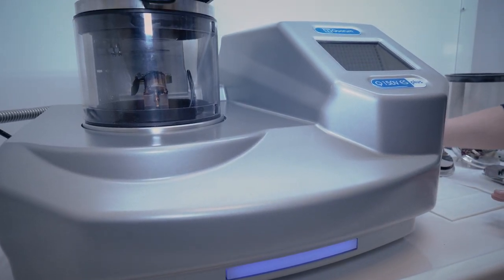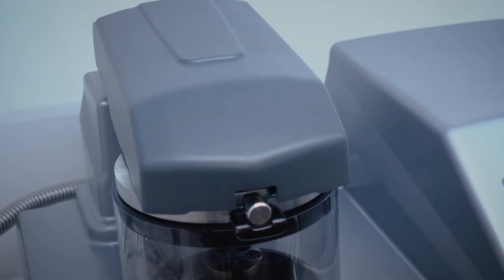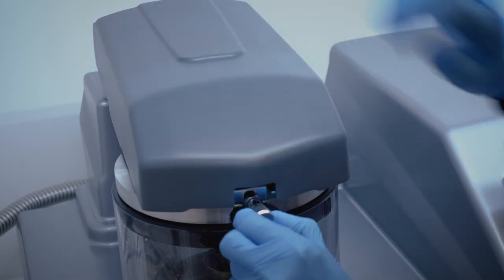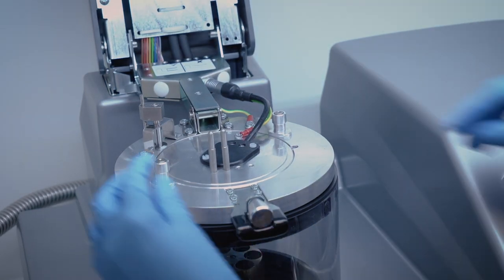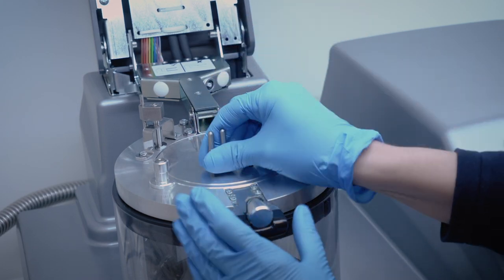To change the target, you will need to open the top lid by slightly pressing the top down and pulling the pin out. This releases the lid and you can then access the mount of the head. To remove the head, we open the safety locks, cable connection and we can take the head out.